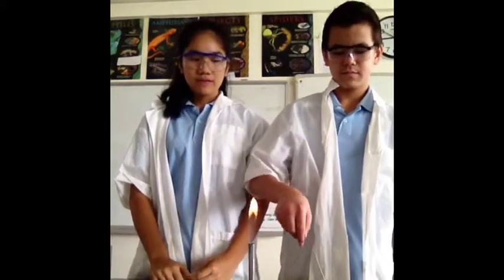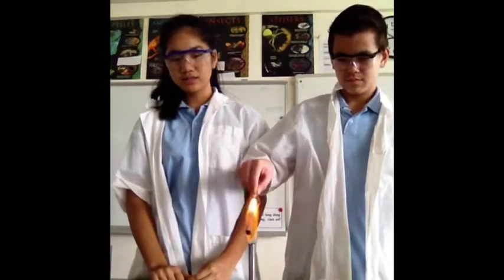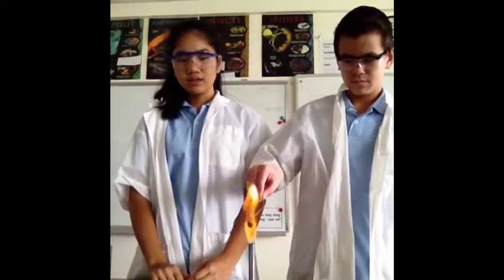We will first add the iron into the fire because this reaction requires thermal energy. After the iron reacts with oxygen in the air, you can see that the fire turns a bit orange and green on the edges. Iron and oxygen yields iron oxide.